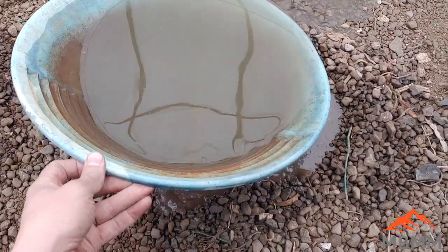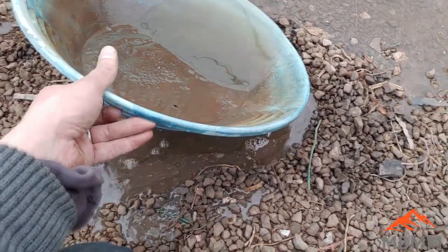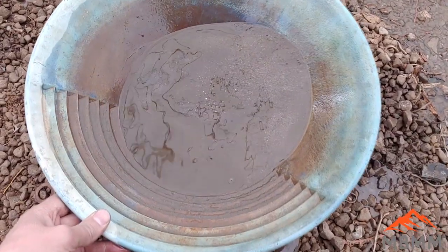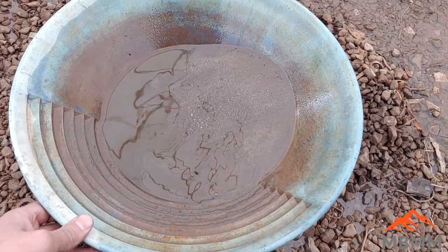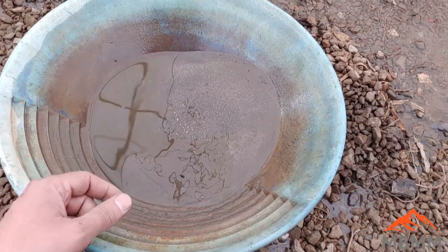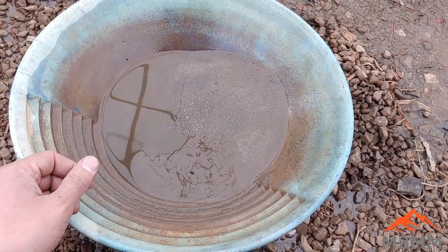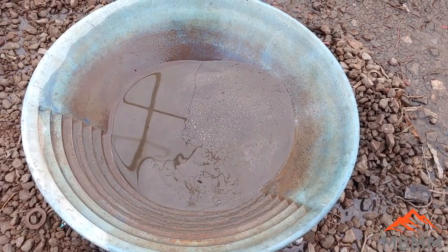It would be really easy to take our panning tailings and smelt these down and see if we can recover any gold out of them. So I'll get these panning tailings dried out, roast them, and smelt them. Then we can have a button from the panning concentrates, a button from the panning tailings, and compare those with the smelt of the original ore — all three together.